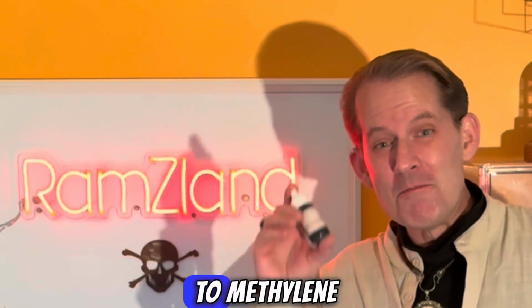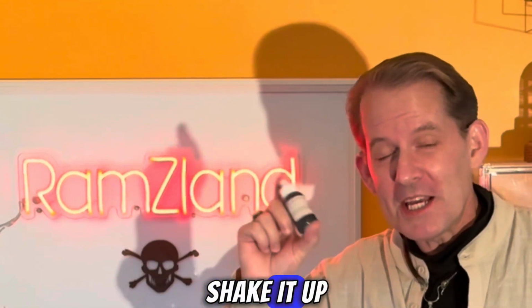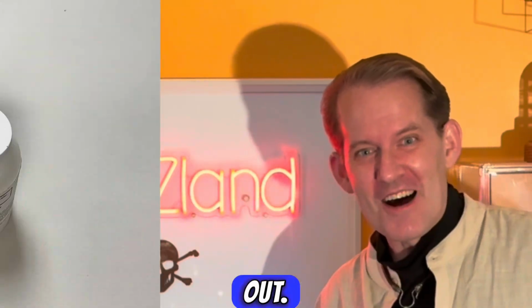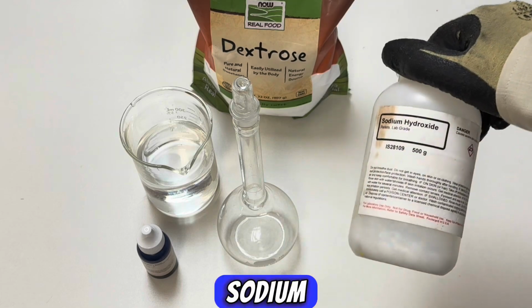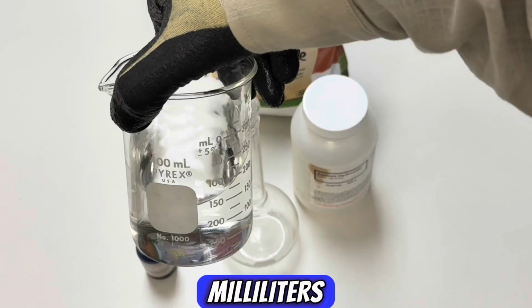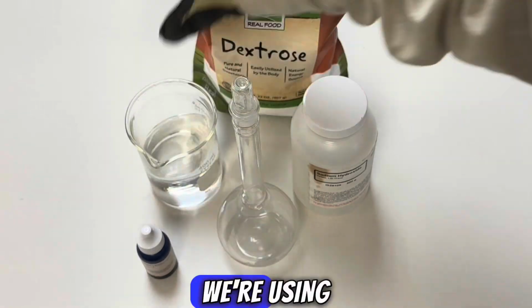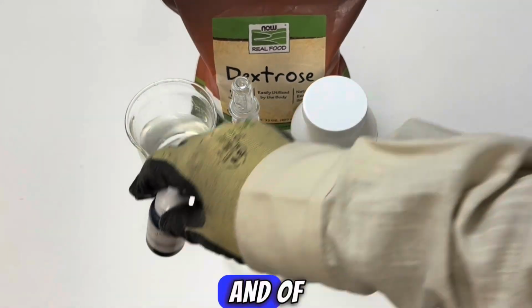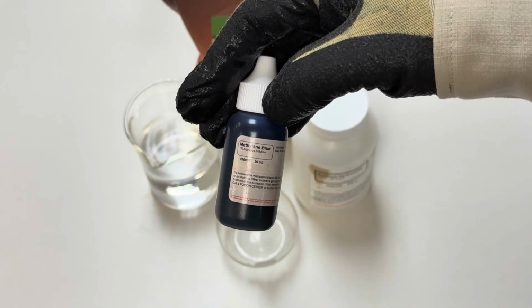What happens to methylene blue when we shake it up in an alkaline solution of glucose? Let's find out. For this experiment, we'll use sodium hydroxide to create an alkaline solution of 250 milliliters of distilled water. We're using dextrose, which is the commercialized version of glucose, and of course, methylene blue.